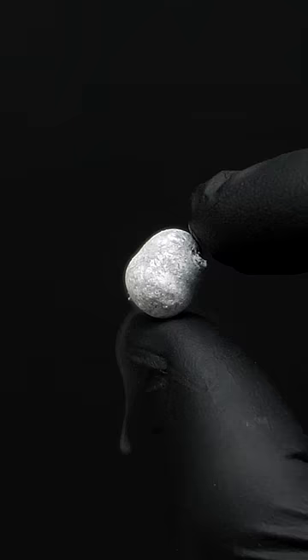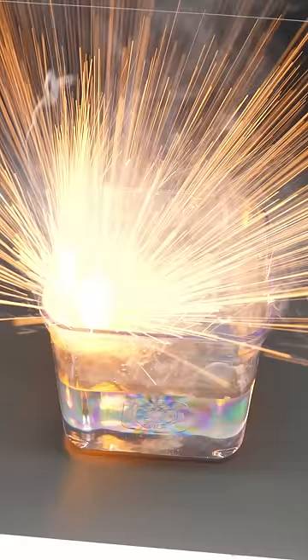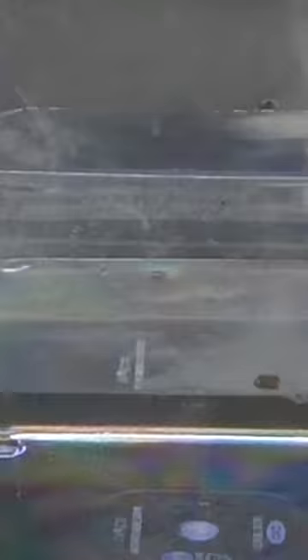Despite it being really cold though, it should still be super reactive, and I just had to see what would happen if I threw it in water. Here we go.